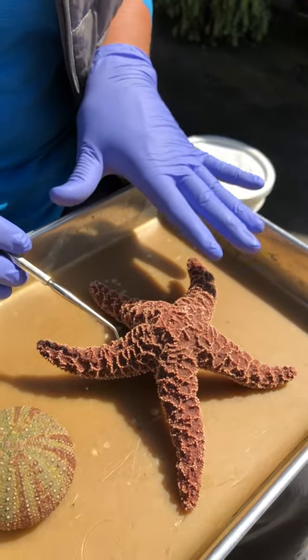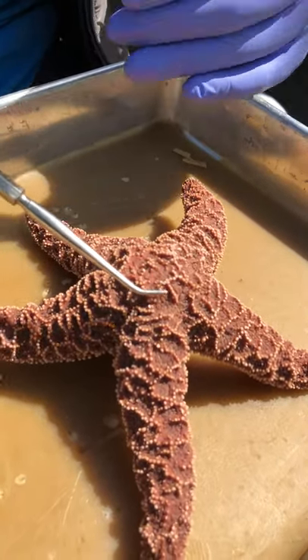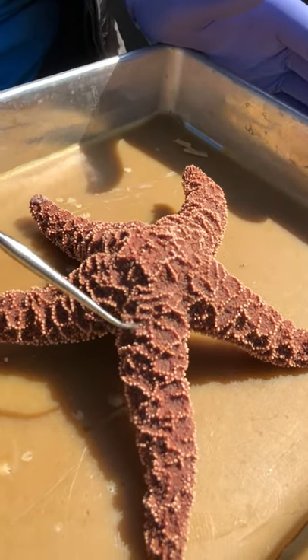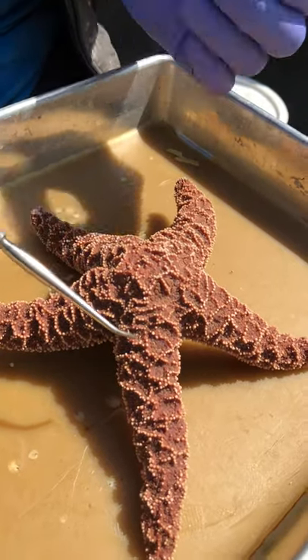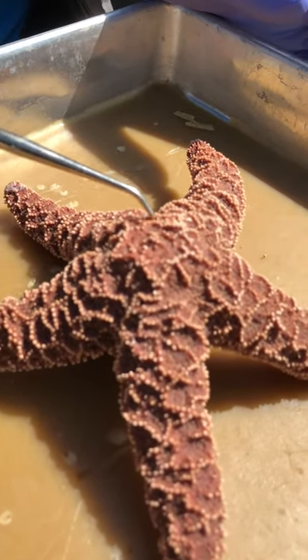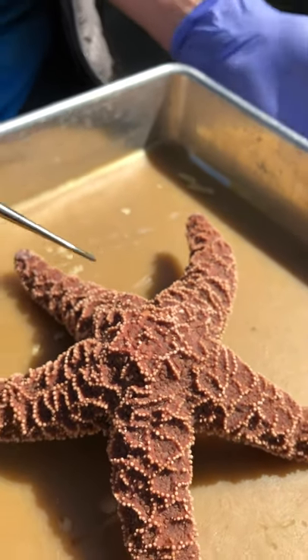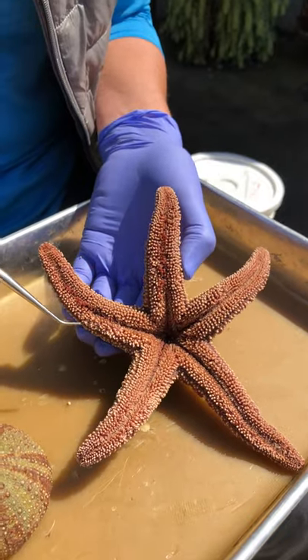External anatomy from the aboral side: it's got this conspicuously hard skin, and these are actually plates from mesoderm under the skin. The epidermis is on top, and some of the soft material — it's hard to distinguish what's epidermis from what's also the lining of the coelom poking up, which is going to be doing gas exchange here as well. We do have some soft tissue here. Then this feature right here is called the madreporite, and that's involved in exchanging seawater — it's the seawater that's really the stuff inside the water vascular system, which is how these animals move. There are great animations about the water vascular system in the other videos.